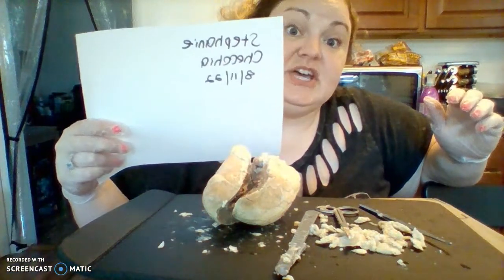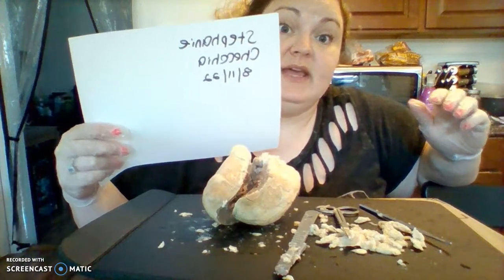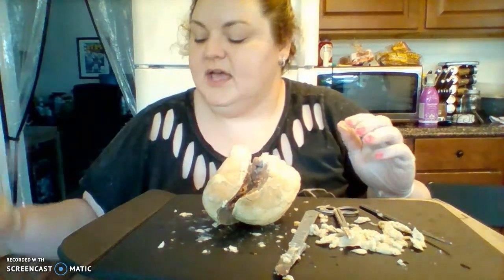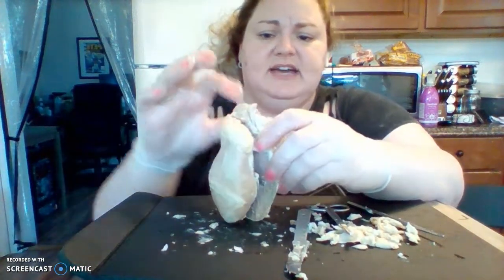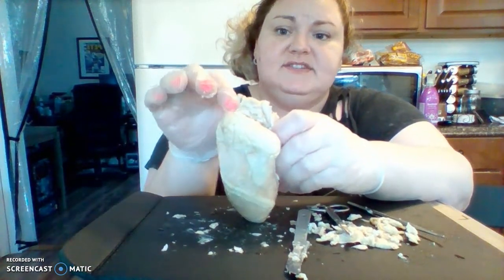So my name is Stephanie Checchia, and I am recording the sheep heart dissection. Now my heart was kind of difficult. It was very fatty and kind of squished, so it was pretty hard to identify some of the features.